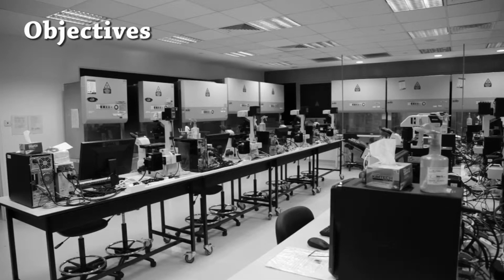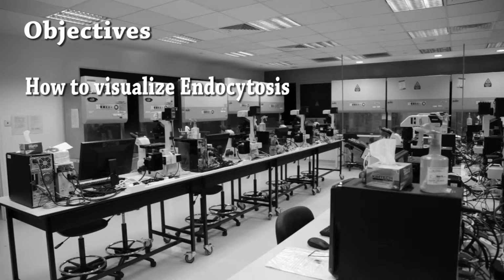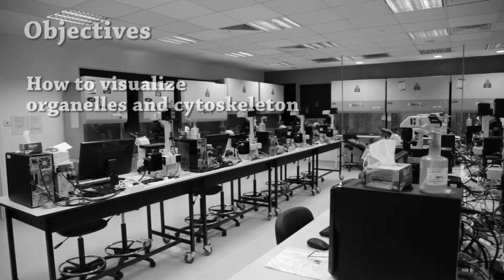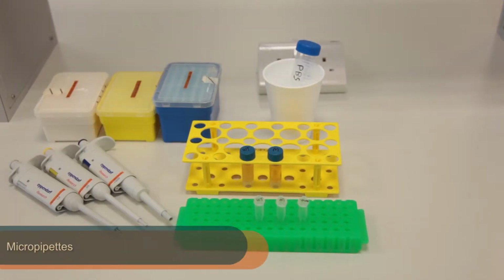Here are the objectives: hands-on experience with the inverted microscope, how to visualize endocytosis, and how to visualize the organelles and cytoskeleton. These are the reagents and equipment needed. Do check if you have everything before you start.